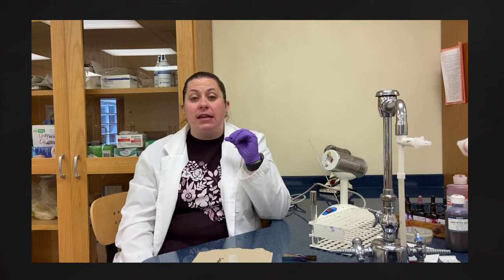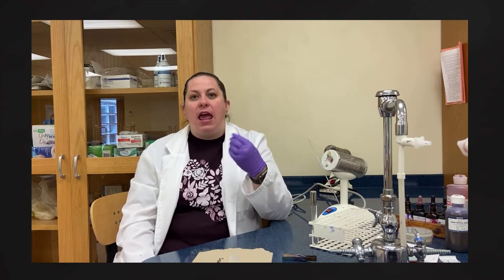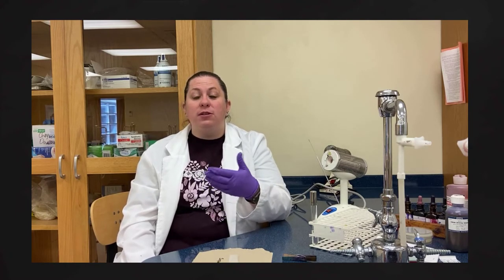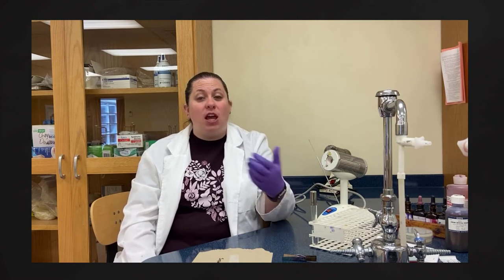Another type of differential stain is called acid-fast staining. This stain is important for bacteria that have a waxy type of cell wall, meaning they have mycolic acid present — a more lipid-based layer. These bacteria do not gram stain well, so acid-fast staining is a way to visualize those cells more effectively. It is a differential stain because we use several stains as well as several steps to achieve the end result.